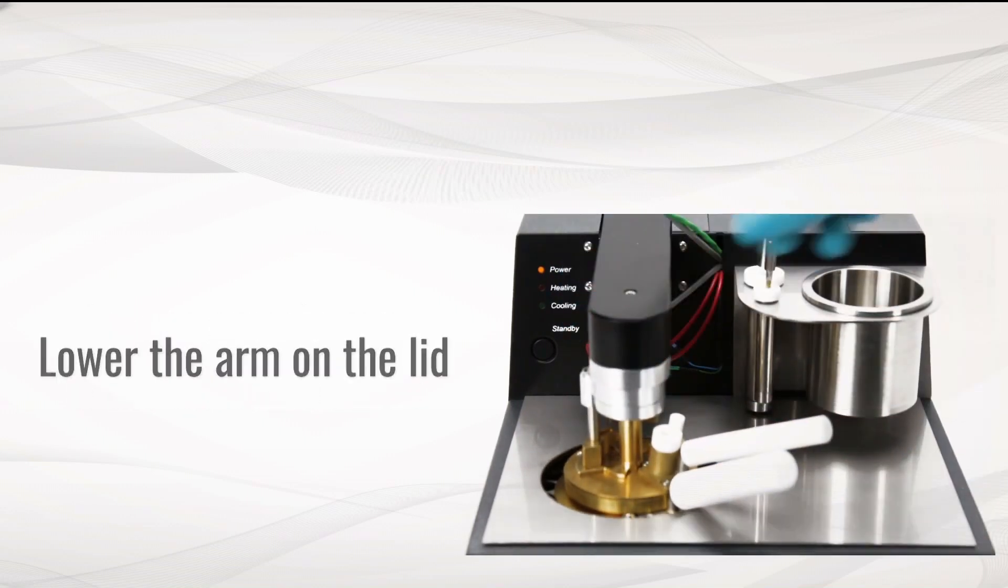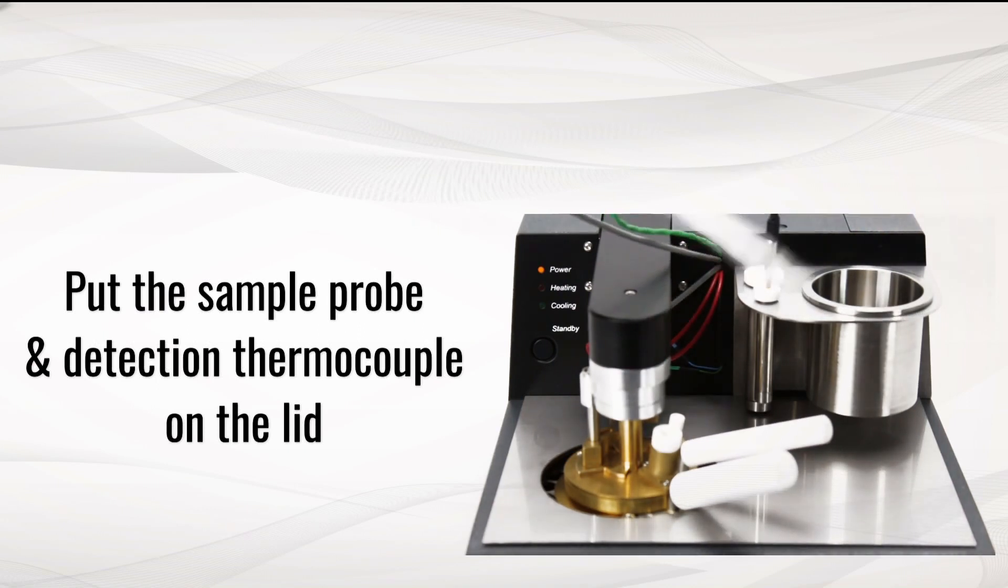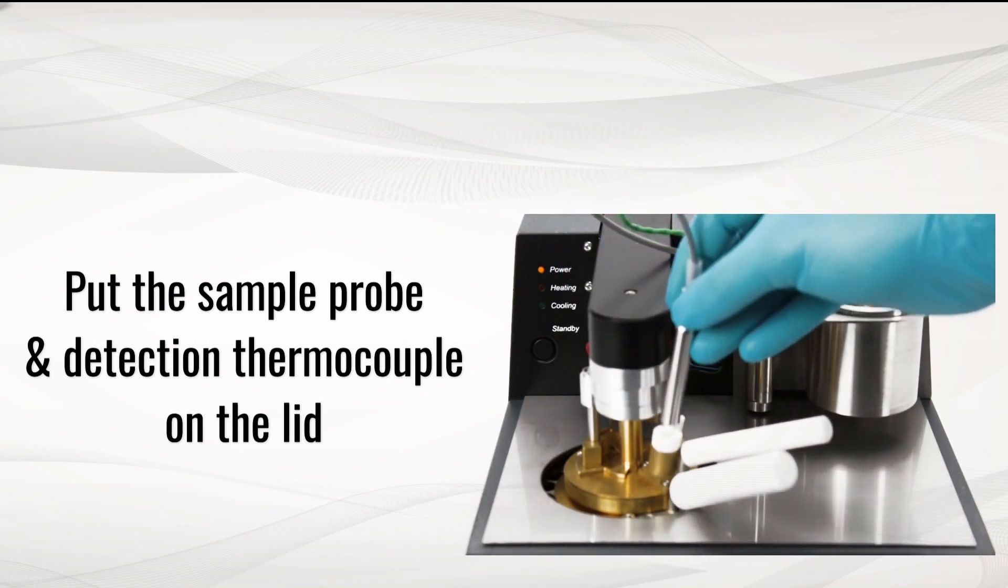Lower the arm on the lid. Put the sample probe and detection thermocouple on the lid.